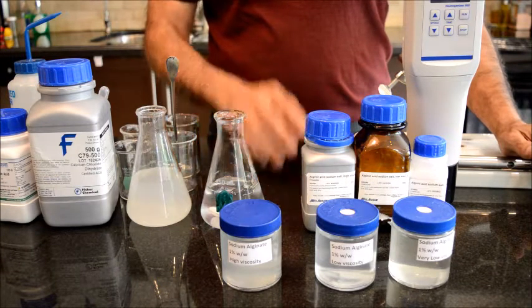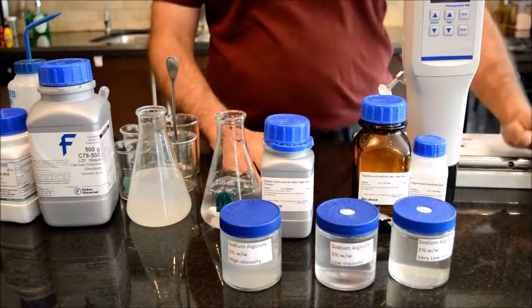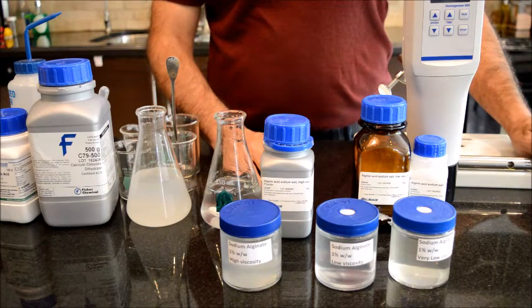So the material is dispersed in water with high agitation, and then solvated overnight. Now if you have a homogenizer like this machine that I have here, then the process would be much faster. But if you don't have a homogenizer, probably you can use a high shear hand blender at home.